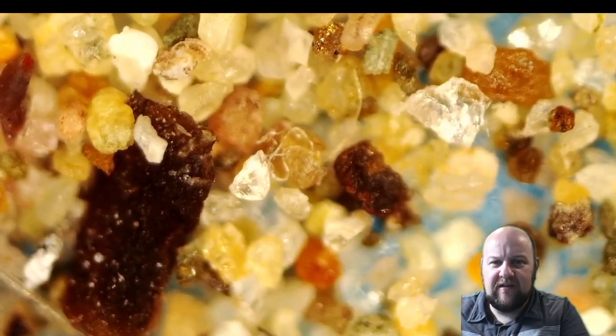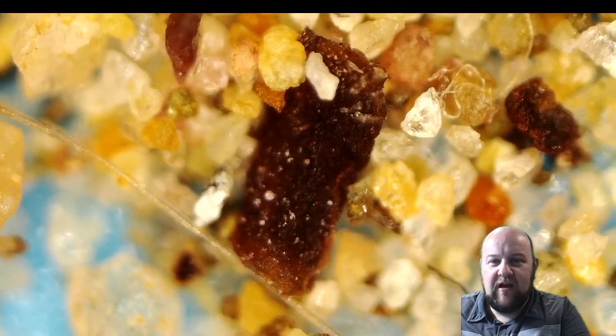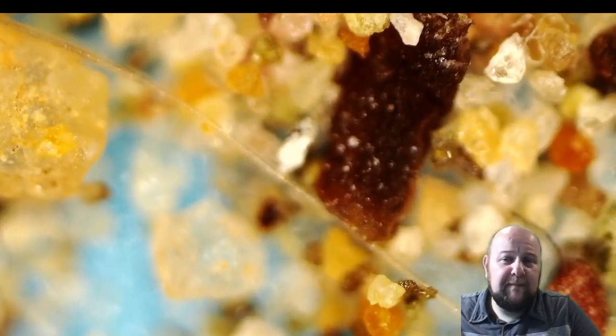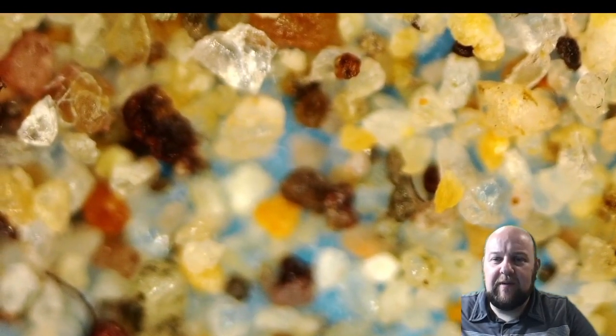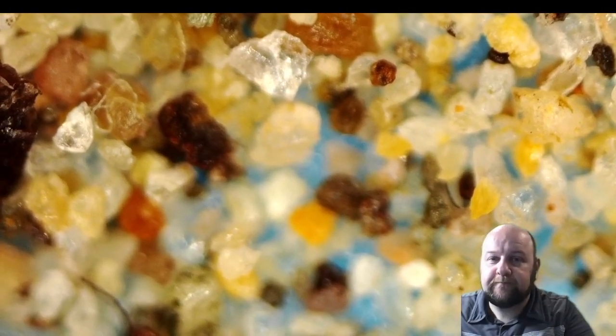It's that big dark thing. I think that's other kind of debris. Also, though, you see a bunch of little fibers that could just be from our clothes. But beach sand is pretty dirty. There's so much people and litter and wildlife going through here that it's hard to get just pure sand at a public beach as busy as Santa Monica. That's where we were, was in Santa Monica.